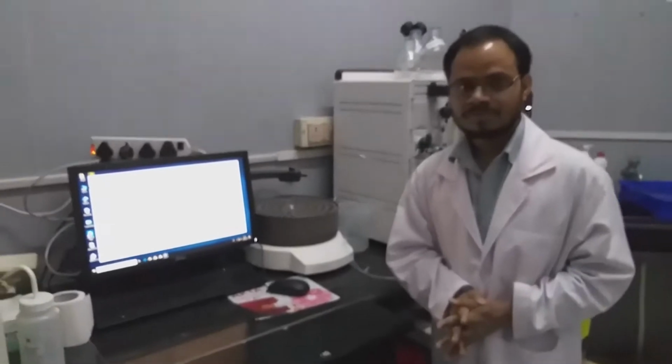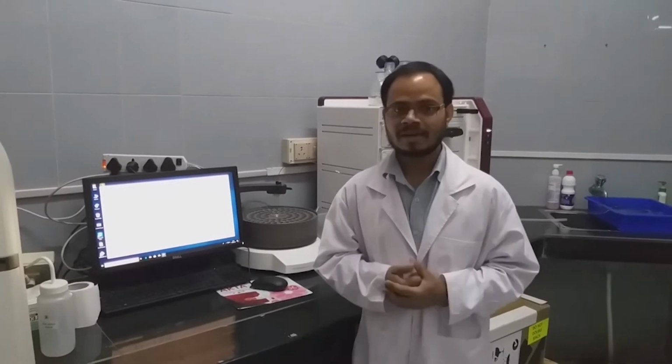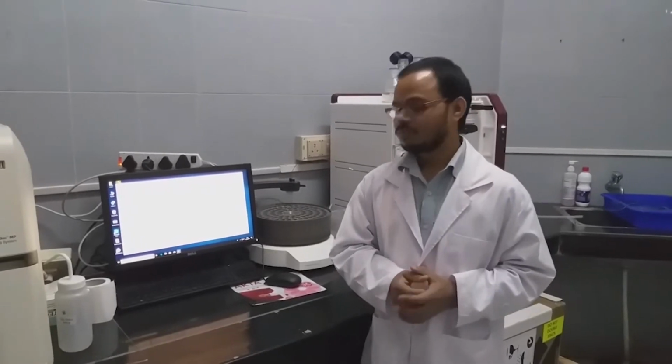So in summary, in this video we showed how to run a gel filtration, we showed manually how to pack the column with the beads and also connecting through the instrument. So I hope this will help your research, to improve your research.